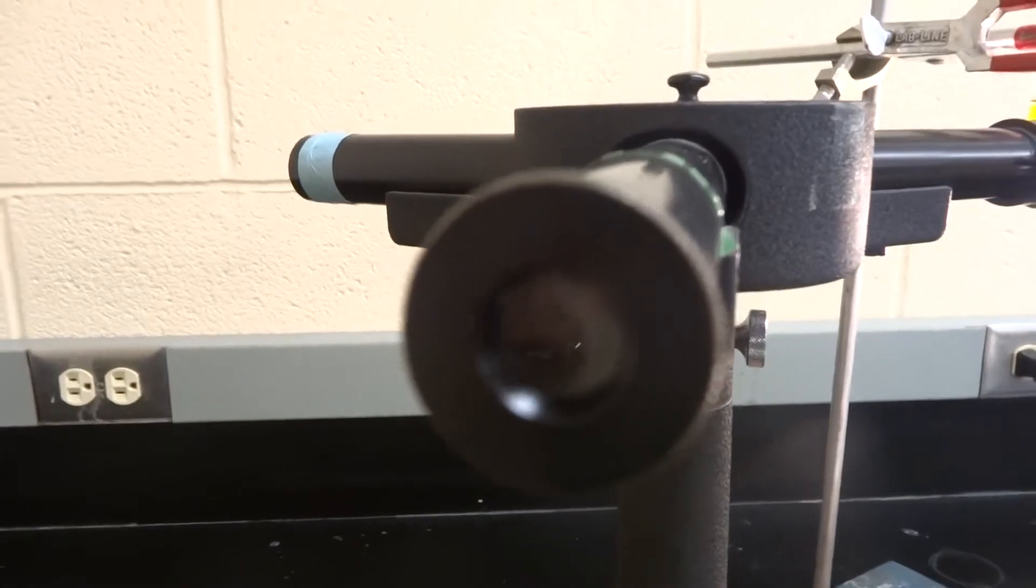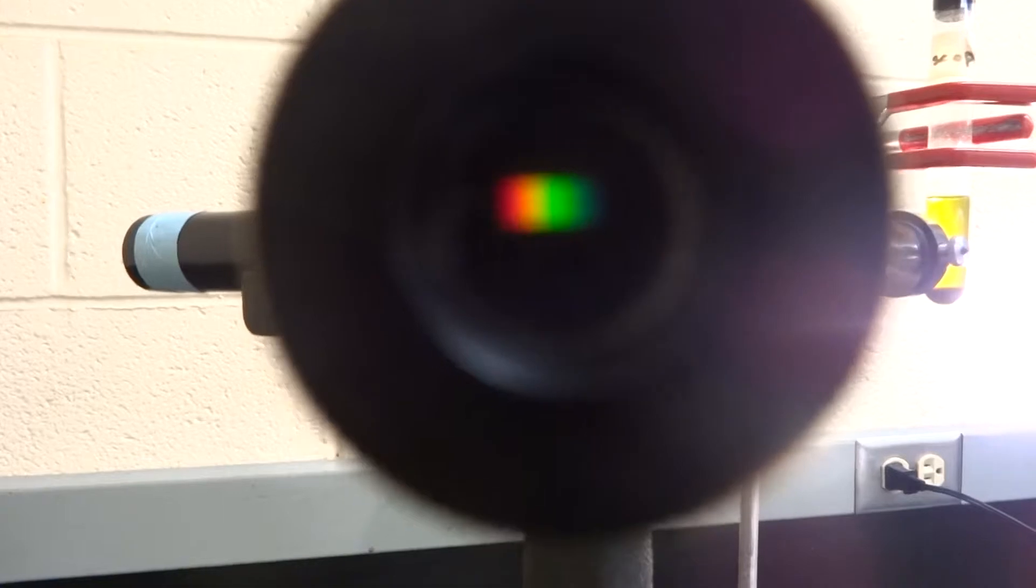Now if I move the plant in front of that, if you look through the spectroscope now you cannot see as much of the blue really and a little bit of the red. I know it's a little unclear but it's still a rainbow.